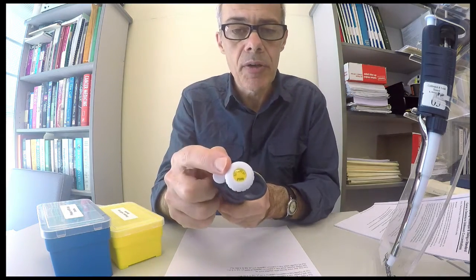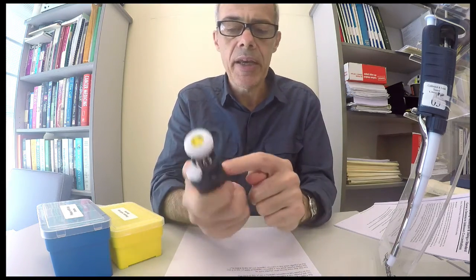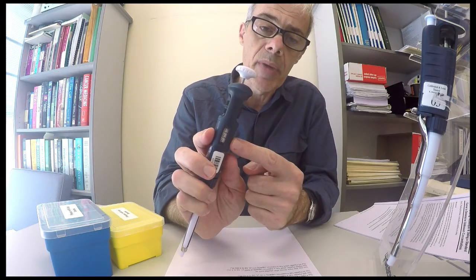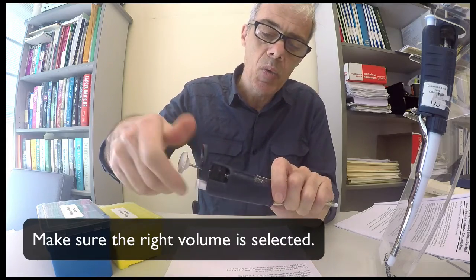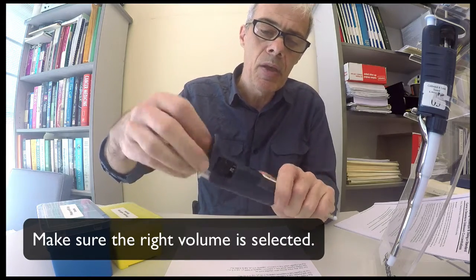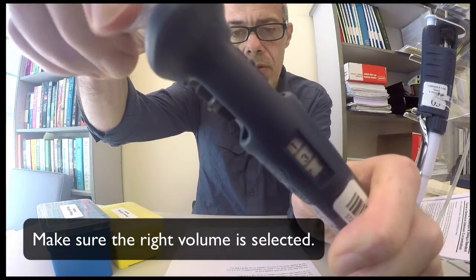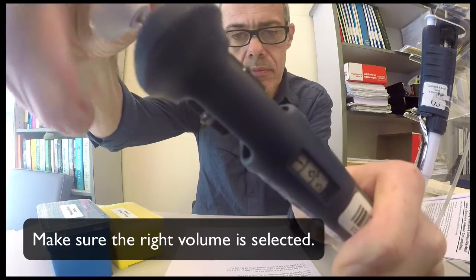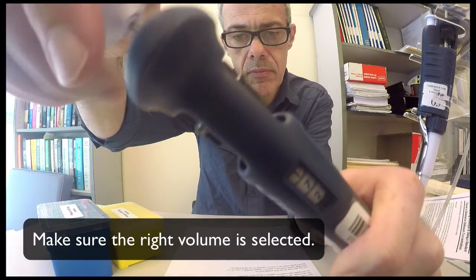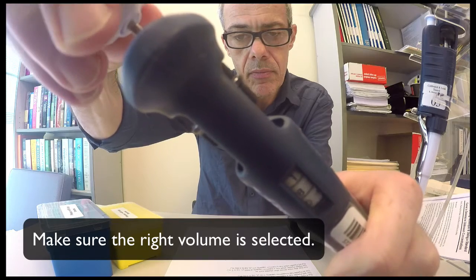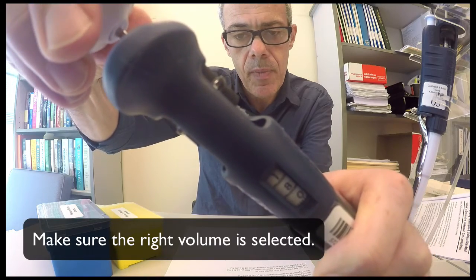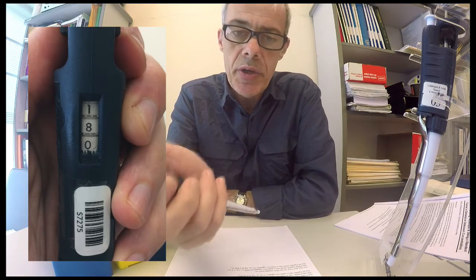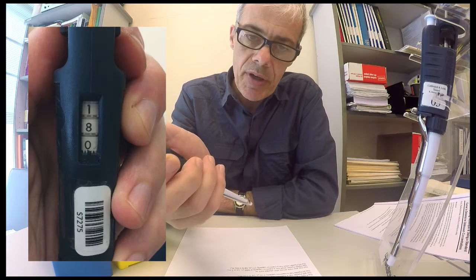So it's a P200, it's set about halfway, it's reading 100 here. So clearly 100 refers to 100 microlitres. So 180, I'll just wind it up until that number reaches 180. There you go, 180, so that's going to dispense 180 units of something, and that is 180 microlitres.